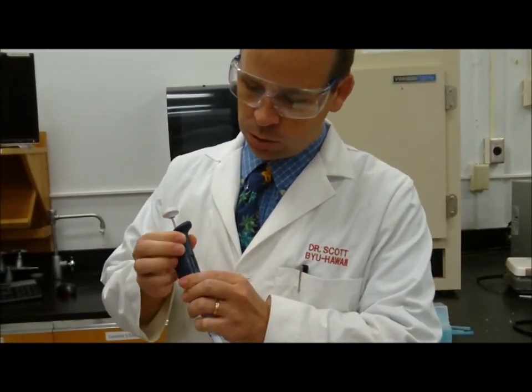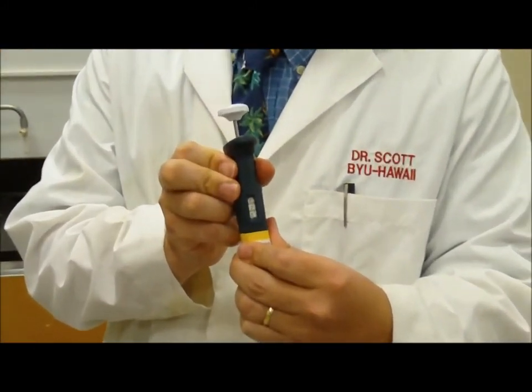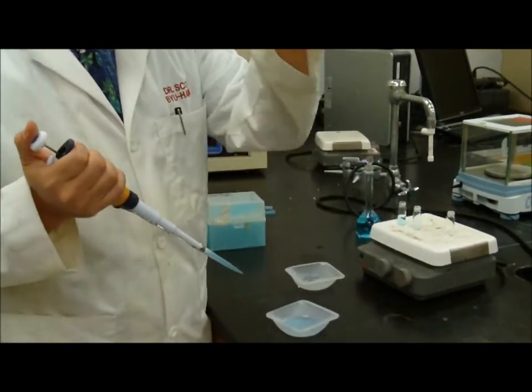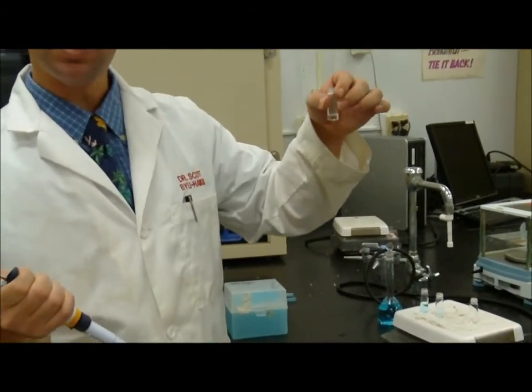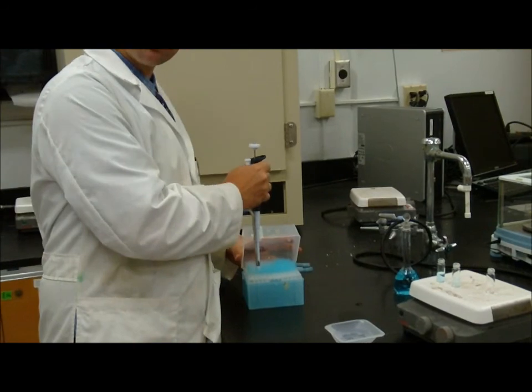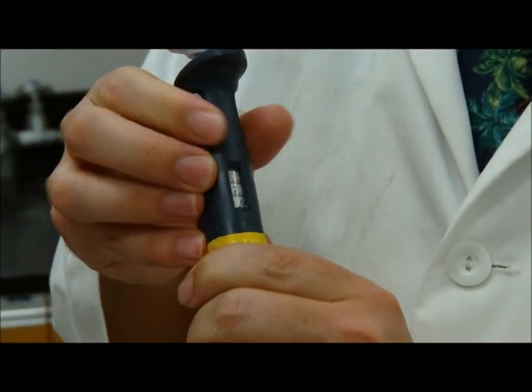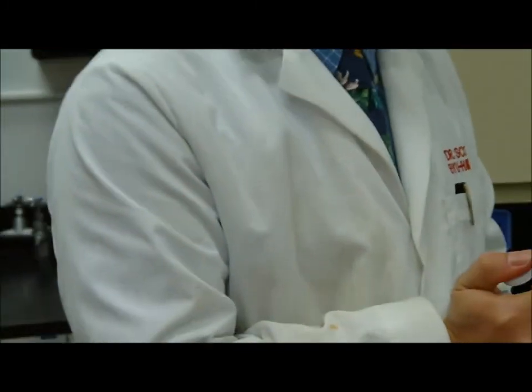I would move this down to 750 microliters, right? Which is 0.75 milliliters. And now I add 0.75 milliliters of water to one of my vials. All right, now I have 0.75 milliliters of water in there, but I wanted it to be 25% copper solution. So now I change the 0.75 milliliters down to 0.25 milliliters, 0.25 or 250 microliters, and that's going to be of the 100% copper sulfate.